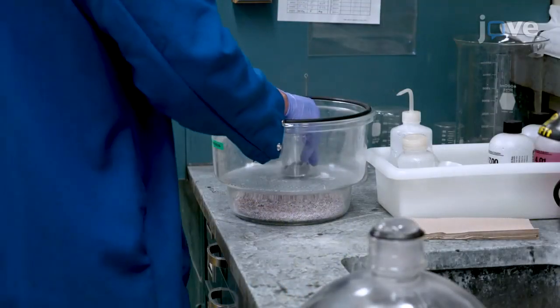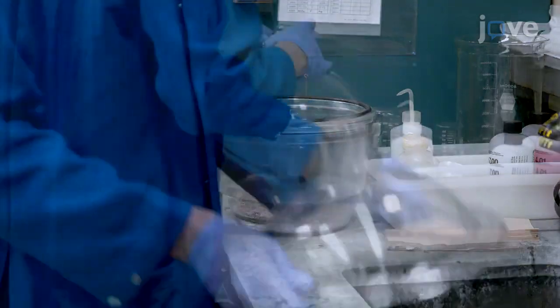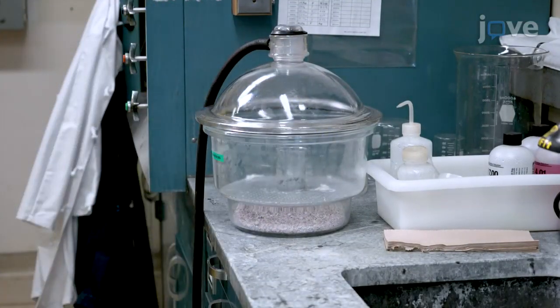Place the beaker in a desiccator for 5 minutes at room temperature to outgas the mixture and its contents under vacuum.